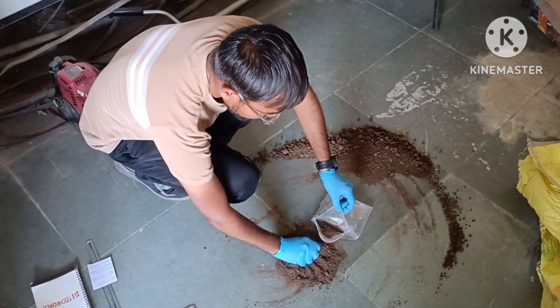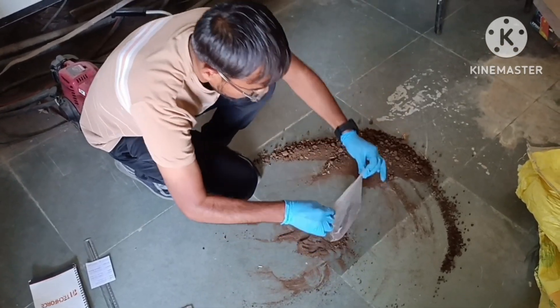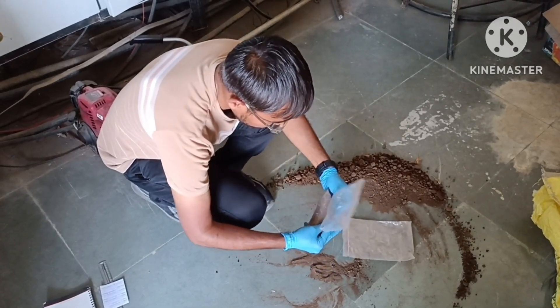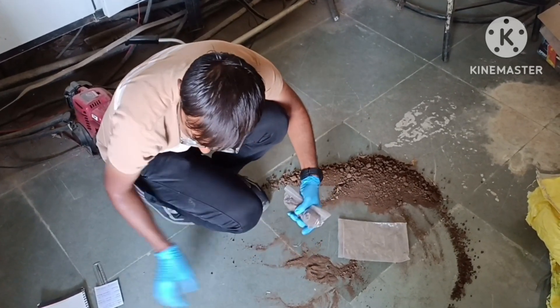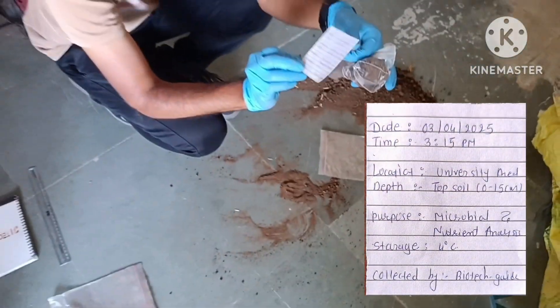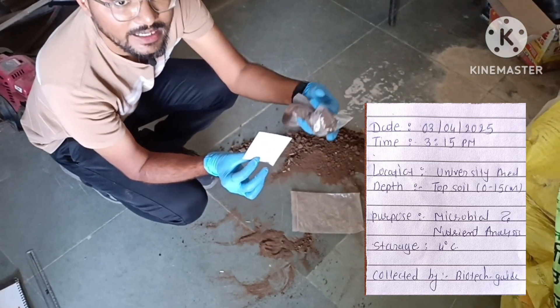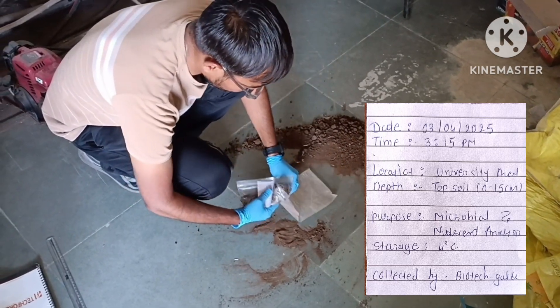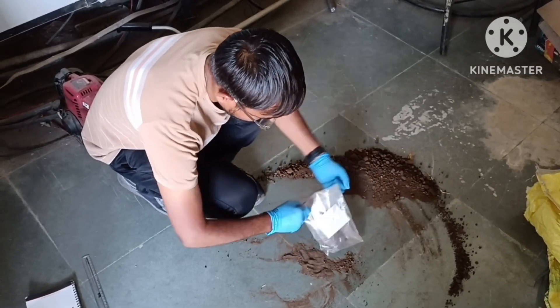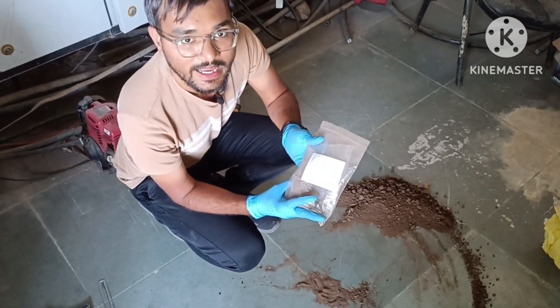We filled it in the zip bag, then sealed it, and put it in another bag with a label. As you can see, the details mentioned are: date, time, location, depth, purpose, storage, and collection. So now our sample is ready for analysis.